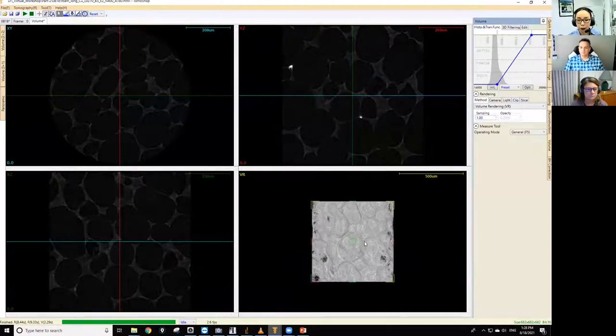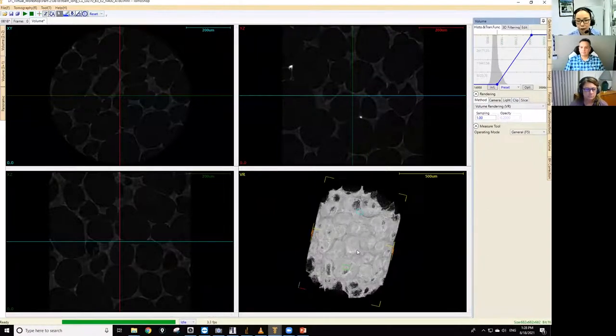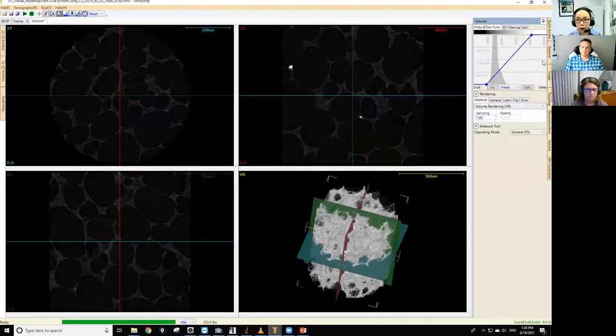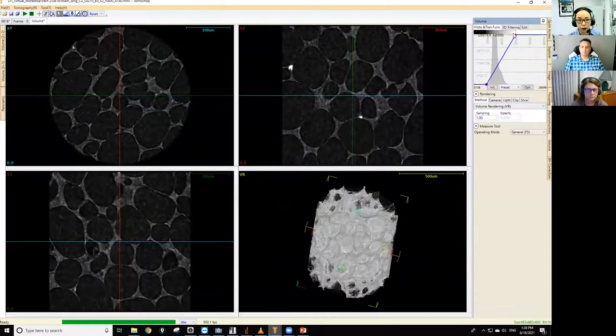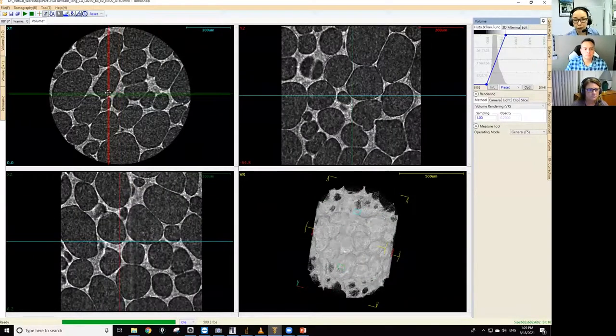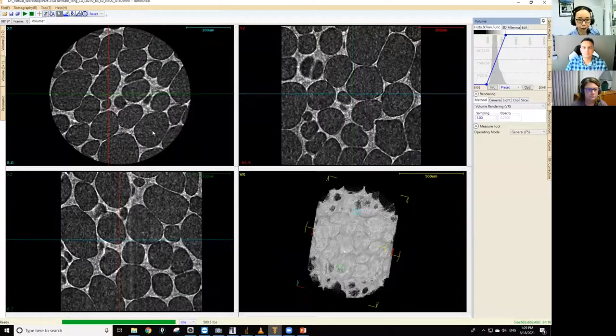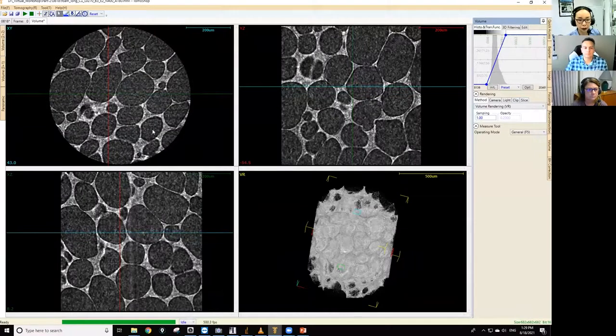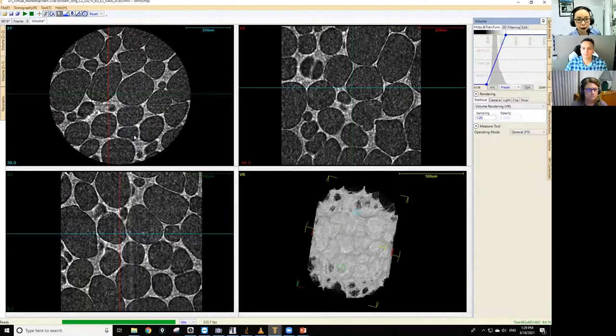Okay, so this is the reconstructed foam in 3D, and it looks reasonable. And those images are a little dark, so let me adjust the window level. Okay, so this looks decent to me. Again, it's a little bit noisy, but it's a 2-minute scan with about a micron resolution, so it's not too bad. But when you scan through this, it's kind of subtle. I don't know if you can see it. You see that there are some streaks going sideways.